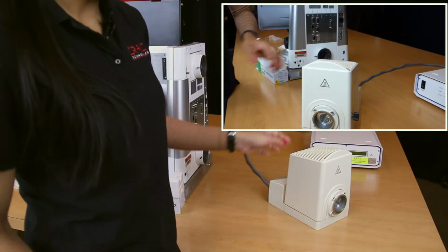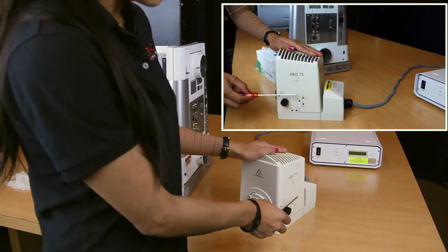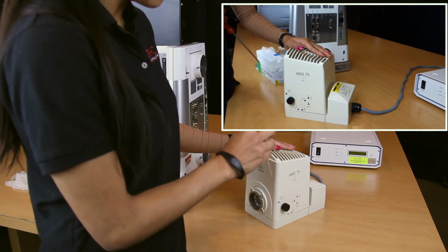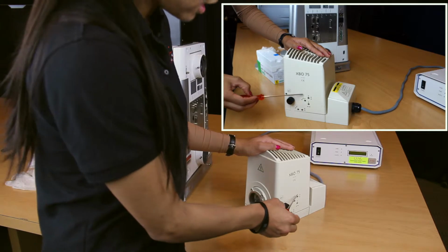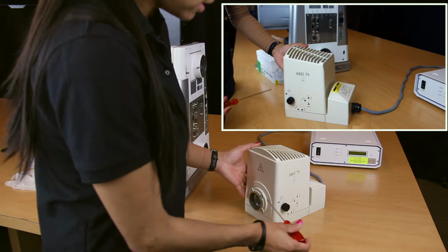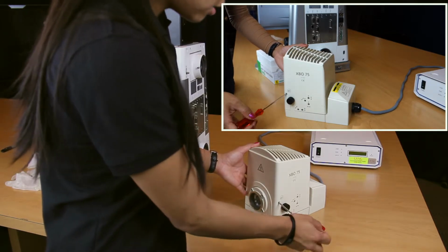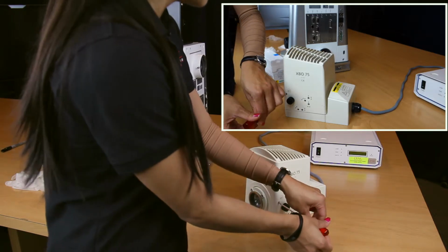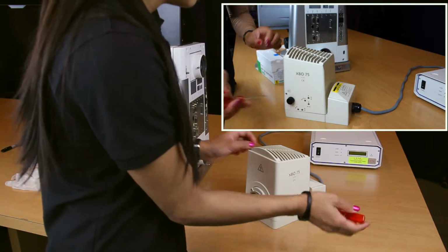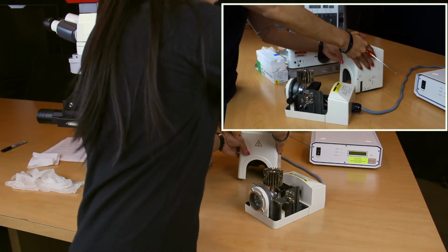So this is your transmission lamp housing. Once you properly remove that from your microspectrophotometer, you'll notice the several arrows here on the right-hand side of the unit itself. This will actually position the bulb inside of the lamp housing, and it indicates in which direction you want to move that. In the meantime, we'll go ahead and remove the cap itself, and by doing so, you want to go ahead and take your 3.5 millimeter Allen wrench and insert into this position here. Rotate in a counterclockwise position until it becomes loose, and remove the cap in a vertical motion. Just go ahead and set that aside.